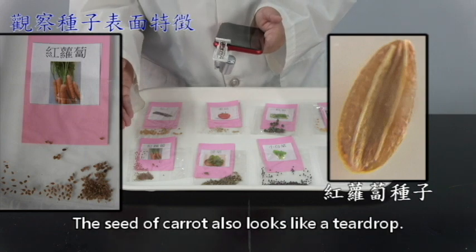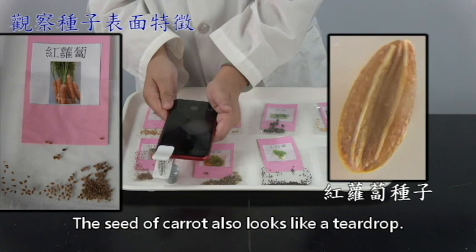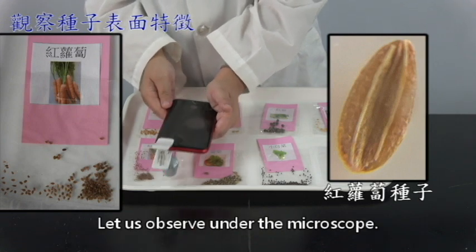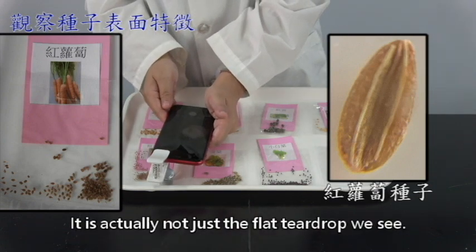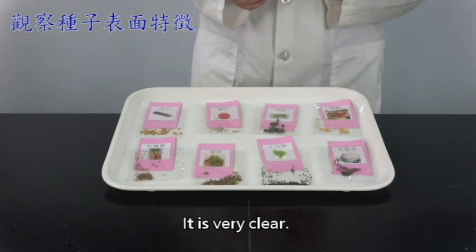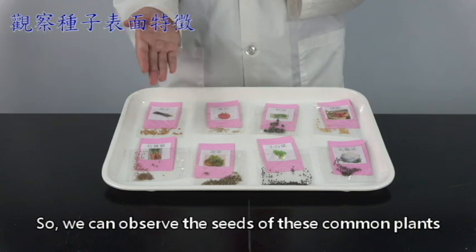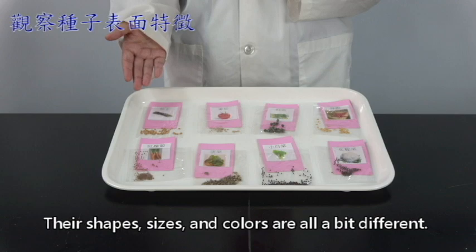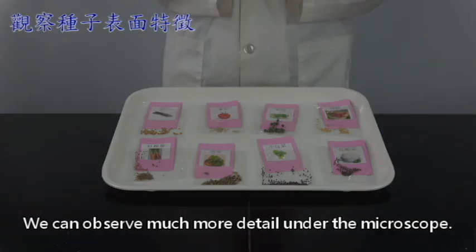Then we observe carrots. The seed of carrots also looks like a teardrop. The color is a bit brown. Let us observe under the microscope. It is actually not just the flat teardrop we see. There are places that protrude. It is very clear. So we can observe the seeds of these common plants. Their shape, size, and colors are all a bit different. We can observe much more detail under the microscope.